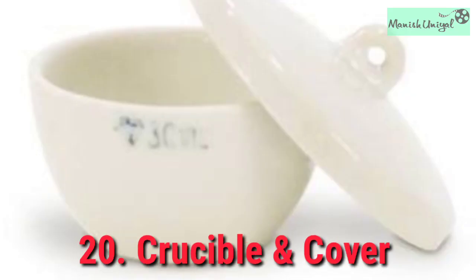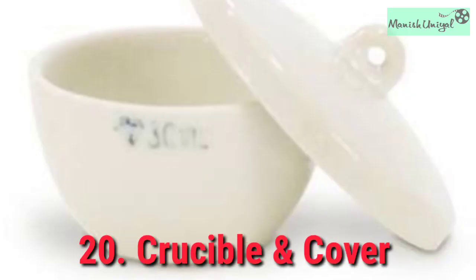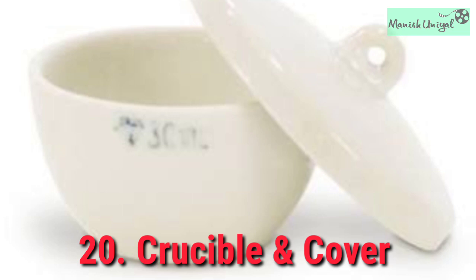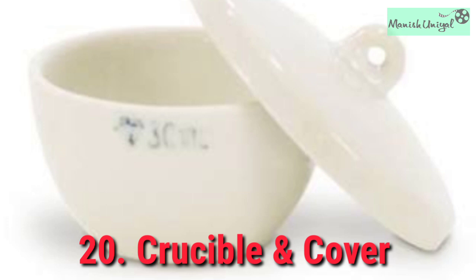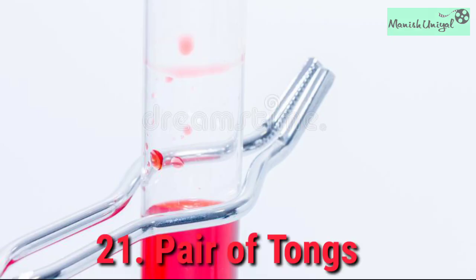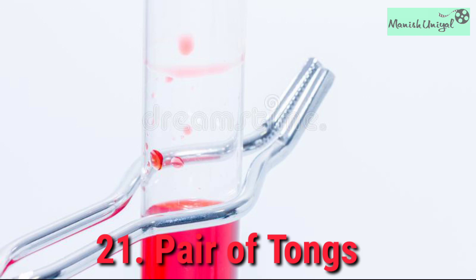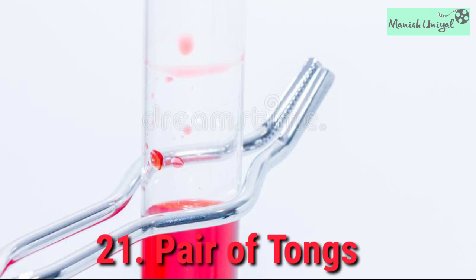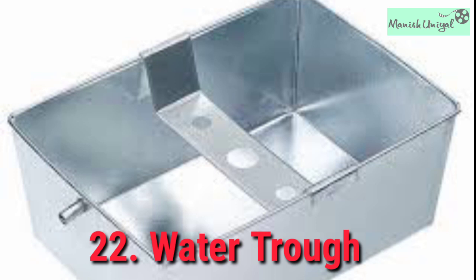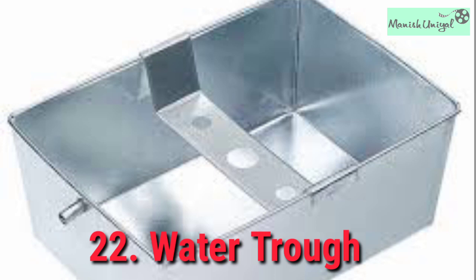Crucible and cover: made of porcelain, used when a substance requires strong and direct heating. Pair of tongs: made of metal, used for picking up apparatus like a crucible. Water trough: made of metal or glass, a big bowl-shaped container used during the collection of gas.